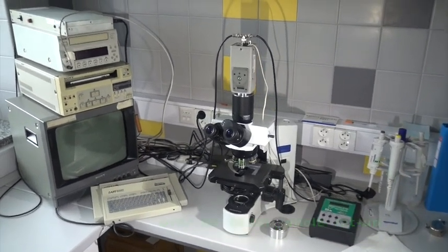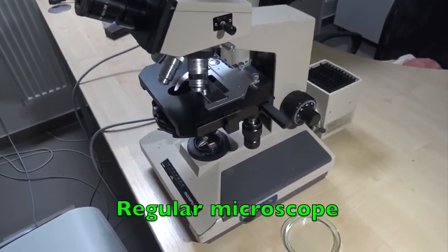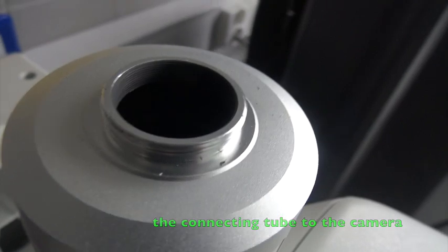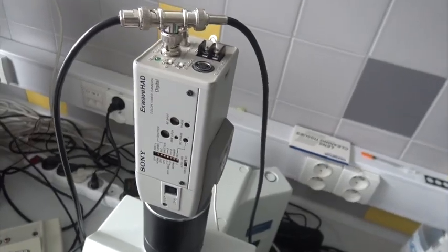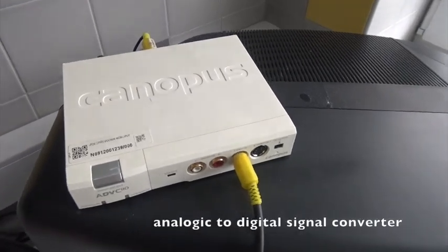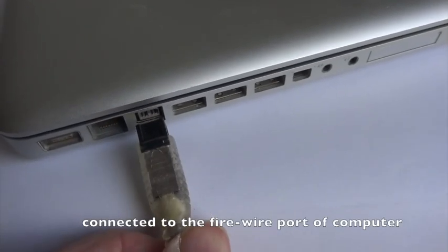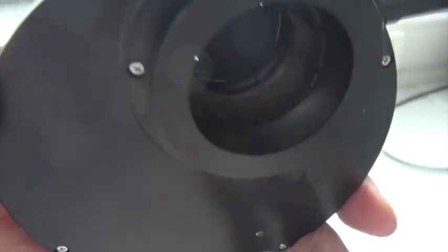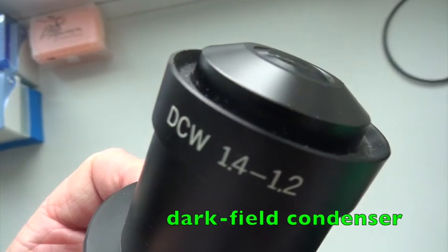The first basic piece of equipment is a microscope which is connected to a video camera by a tube including a projective lens. Inside the connecting tube is a projective lens. The analog video camera is connected to a signal converter delivering a digital signal to the computer through a firewire connection. The condenser of the microscope can be either phase contrast optics or dark field type, the latter including a black central disk.